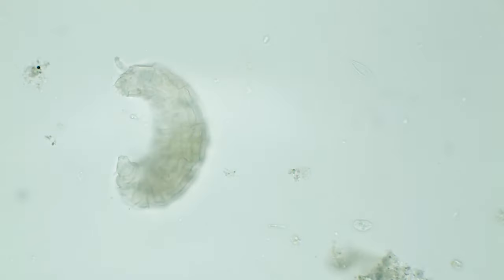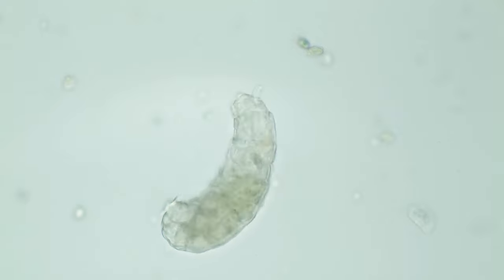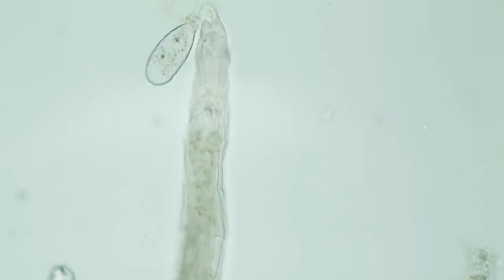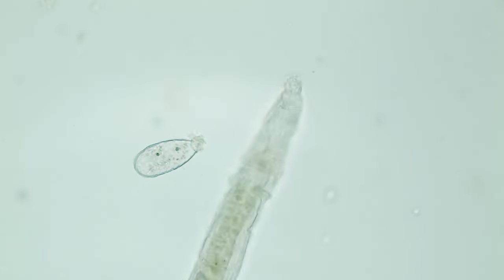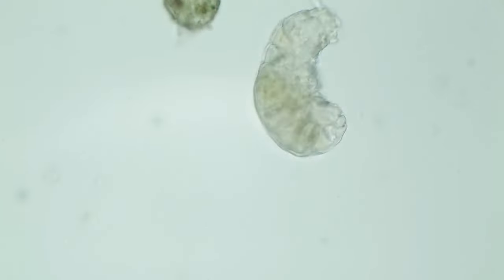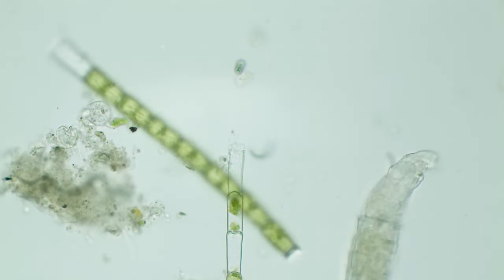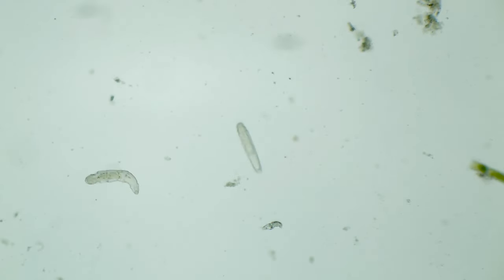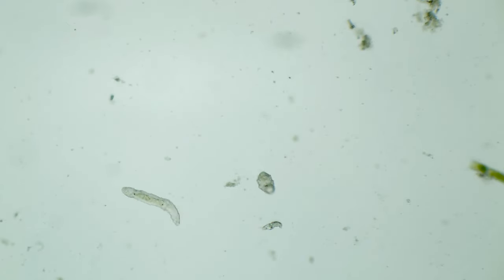We can see that its body consists of several segments and it seems to have a pair of antennae on one of its ends. It looks like these two are reaching a meeting point... or not.